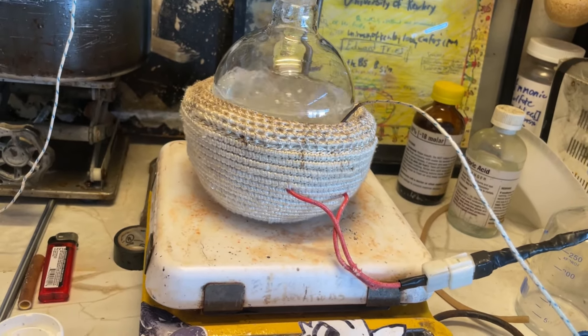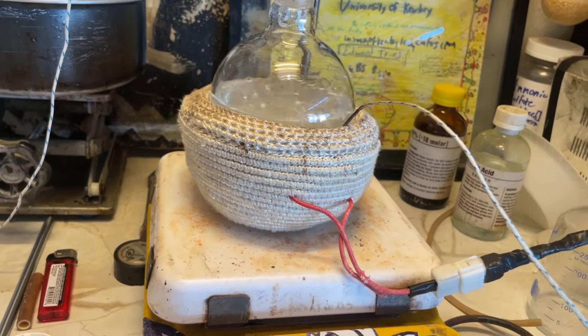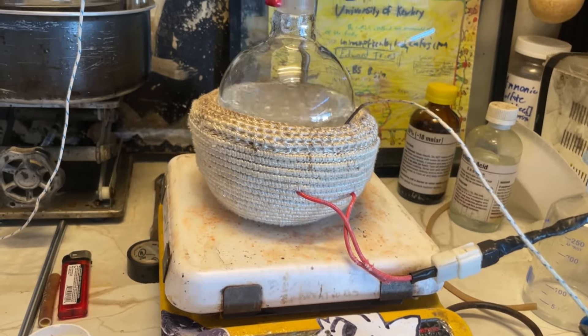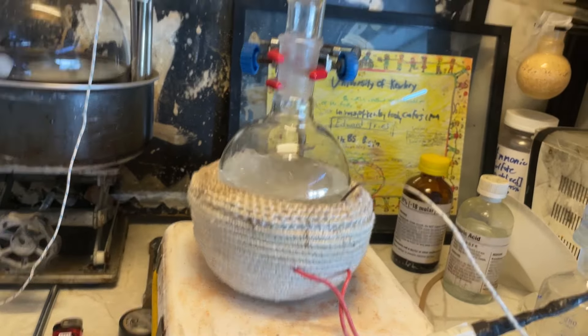Around the halfway mark, I'm gonna acidify it with some sulfuric acid back to pH 2 or so. So as you can guess, this is a lot of waiting for this. But it's organic chemistry. So you can just leave it there sitting and you don't even have to look at it. But yeah, still very, very slow.